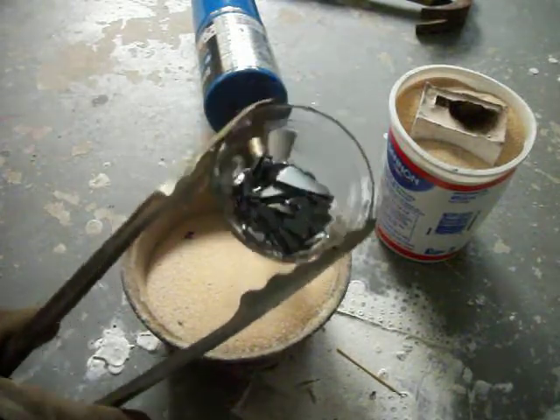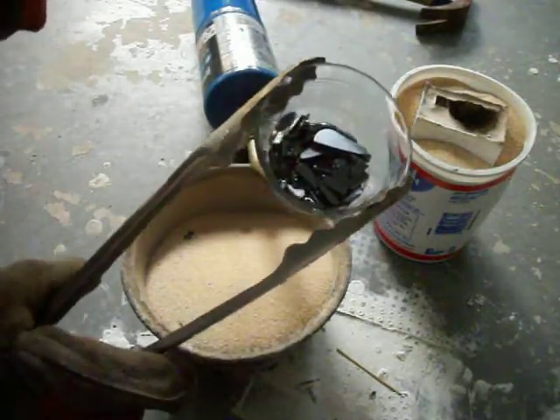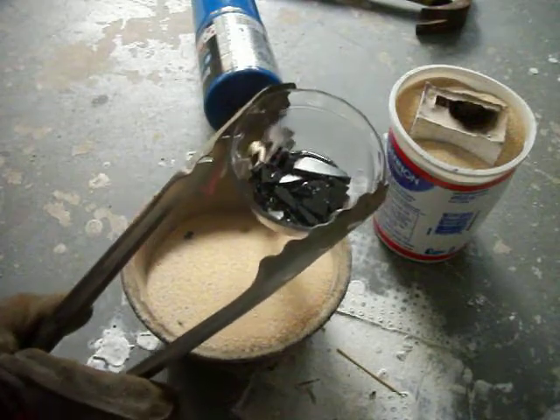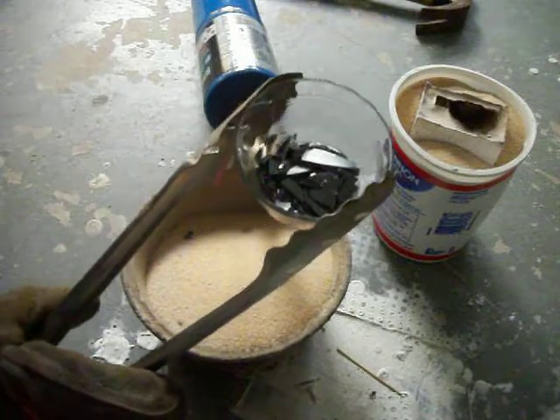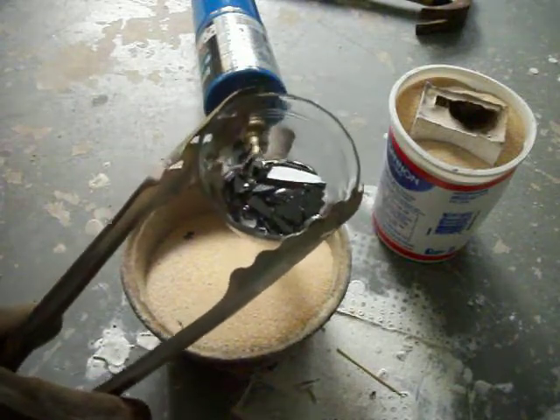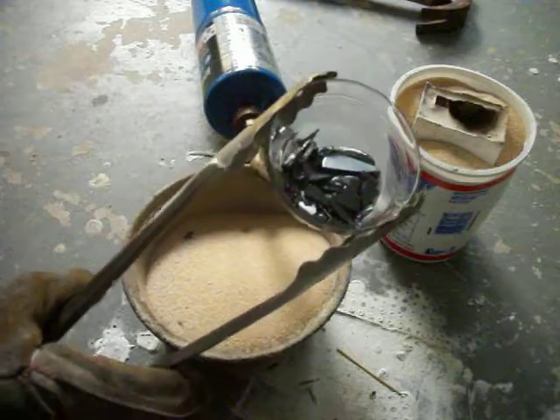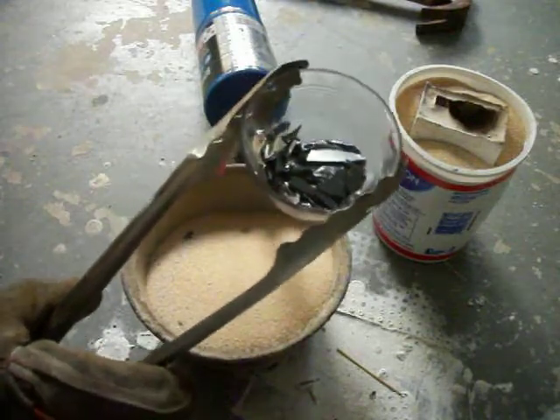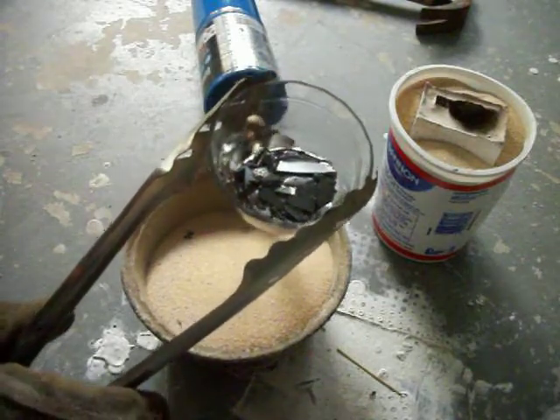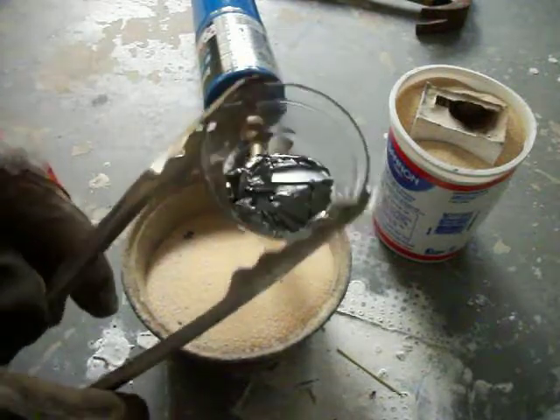You can see it starting to melt right up here. Hopefully this works well with the torch — I didn't want to fire up the foundry just to melt this small sample. Oh good, it is liquefying.